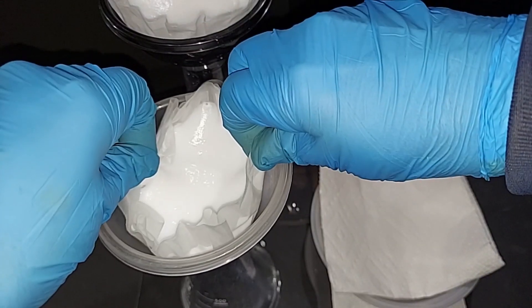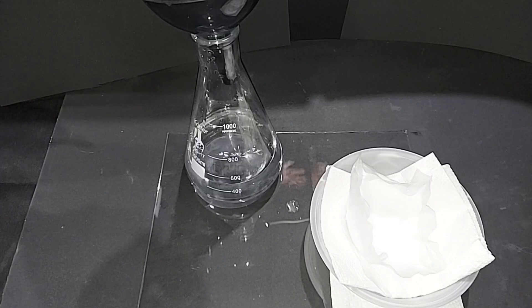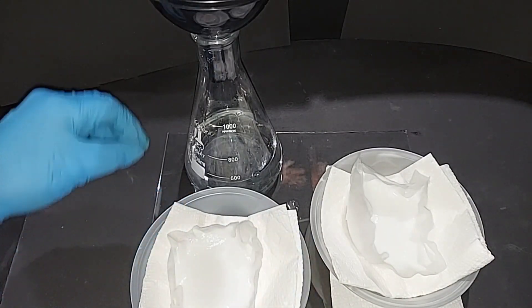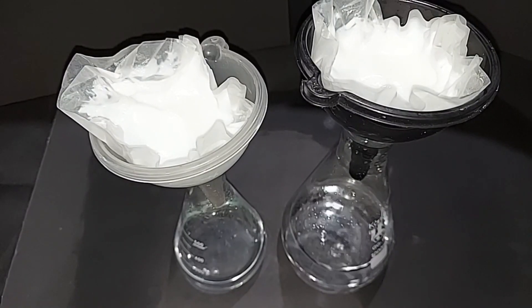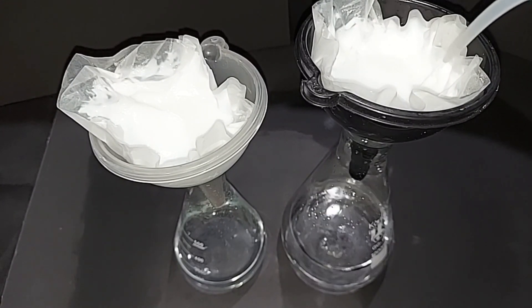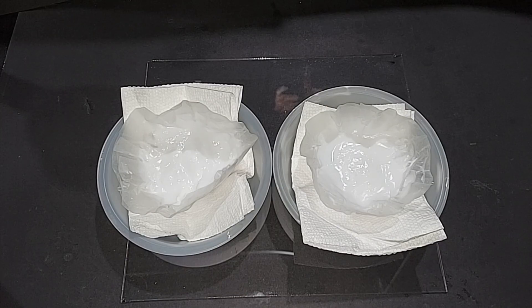Placing the filter paper on top of some paper toweling to dry. I'll probably change the paper toweling a couple of times and keep going until it's dry. I made a simple mistake and did not wash either batch before starting to dry it, so they're back where they were. I'm going to wash both piles thoroughly now to make sure any extra magnesium sulfate and the sodium sulfate we created get washed through.